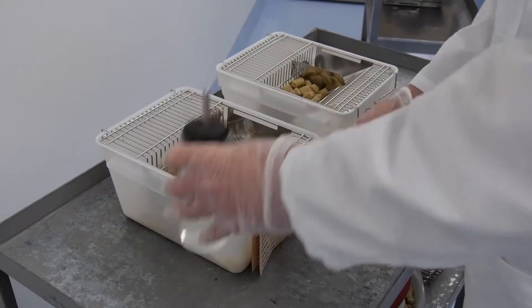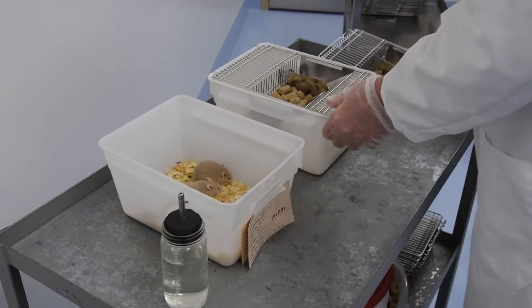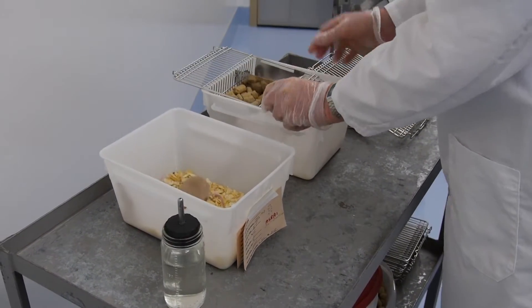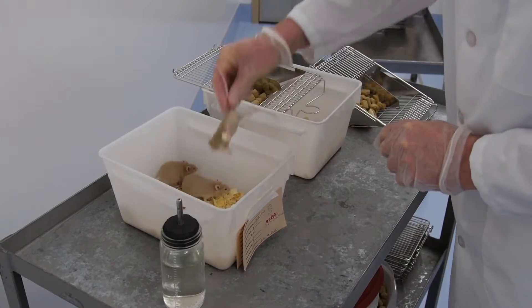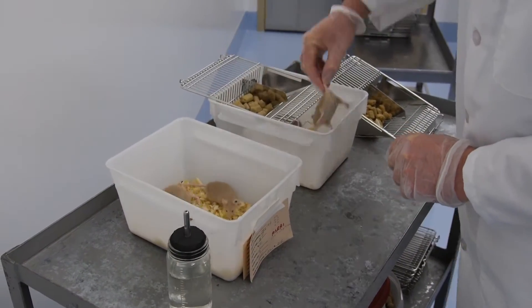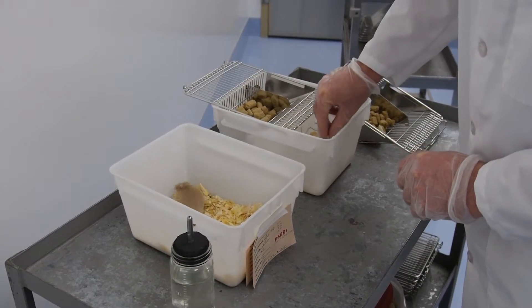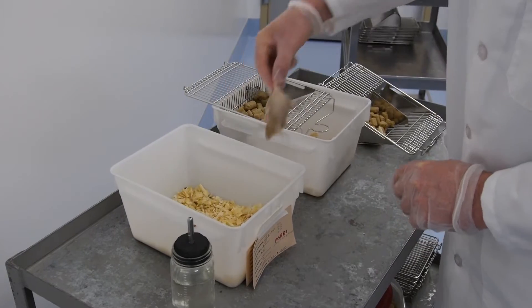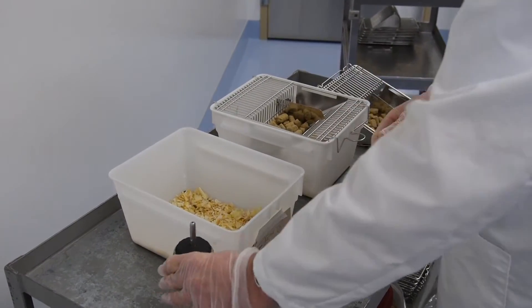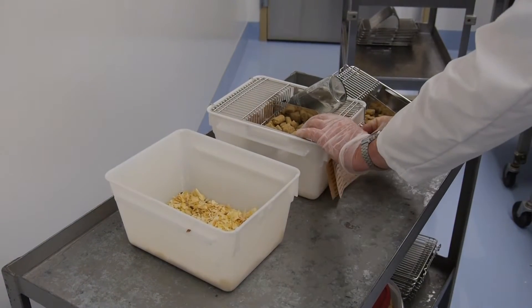In this video, I show you the basic animal handling technique. The mice are picked up by the base of the tail, and you make sure that there's enough space between the cage top and the cage to lift the animals into their new cage. You can see that I picked them up at the very base of the tail to minimize the stress to the animals. And you can see that they're very calm and ready to go into their clean cage with their water and their tag.